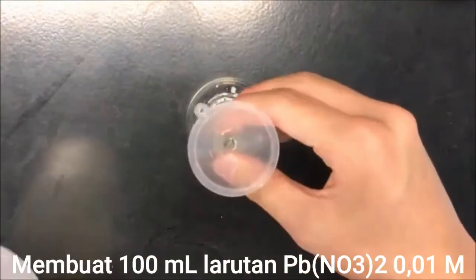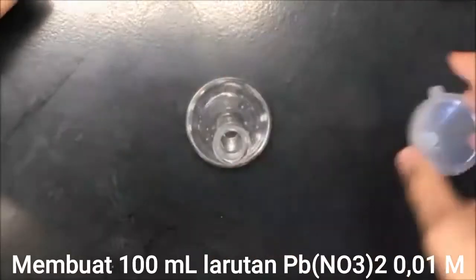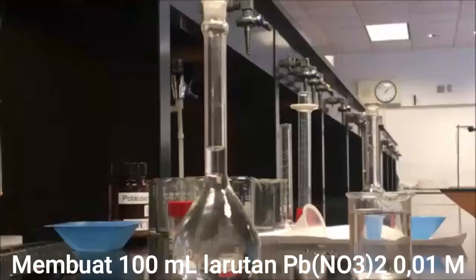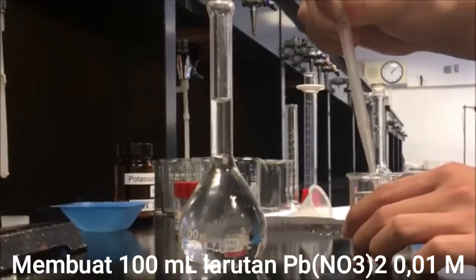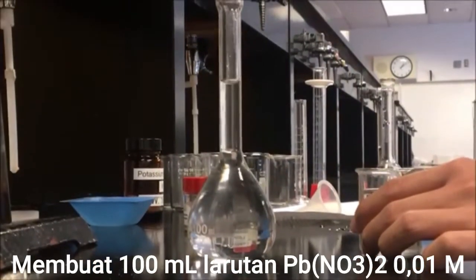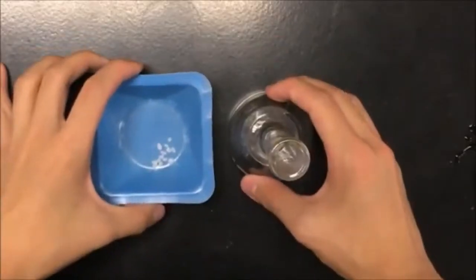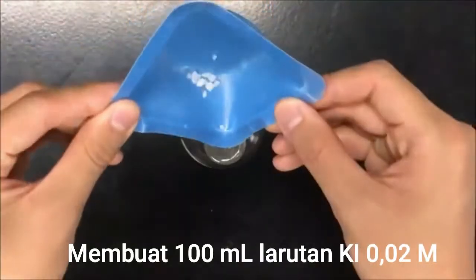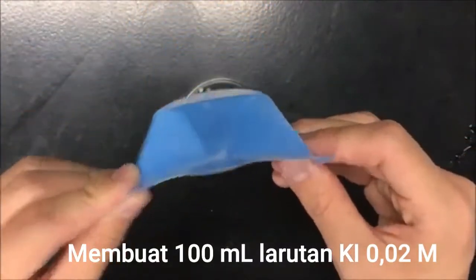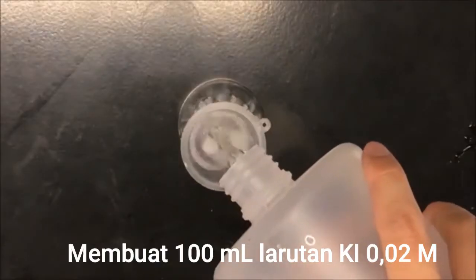Use a funnel to add water to the flask and make sure to mix constantly. At the end, take a dropper and carefully add water so the meniscus reaches the line indicated on the flask. Now, prepare the potassium iodide solution the same way you prepared the lead 2 nitrate solution. Make sure not to spill any of the compound while putting it into the flask.